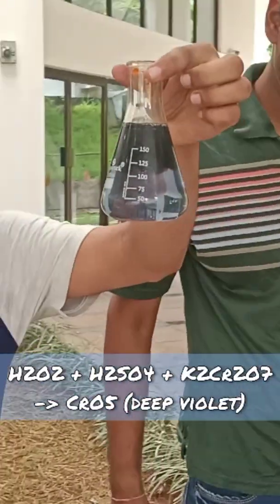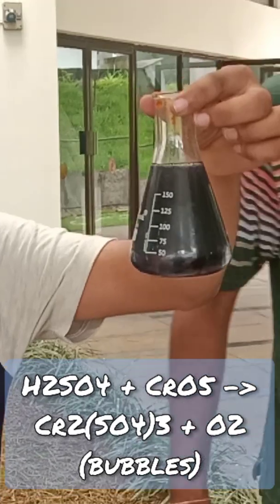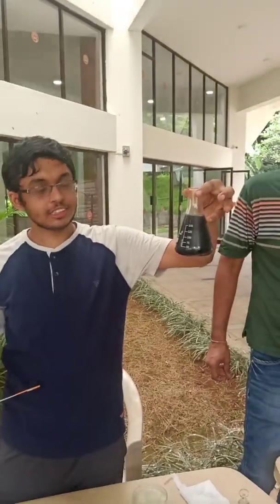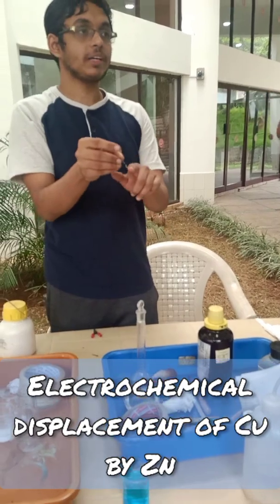You can see that, and you can also see bubbles over here. This is because the complex is unstable and it will dissociate and oxygen will be released. So after some time, the solution will again be clear. You can also see deposition of copper over the zinc surface.